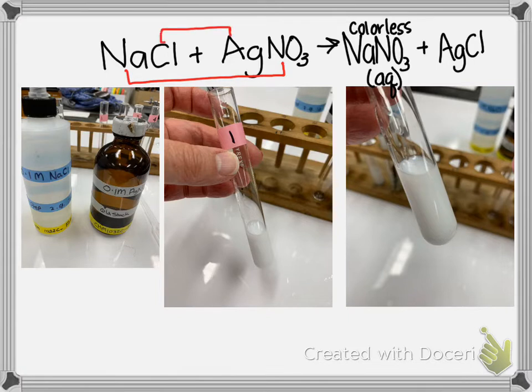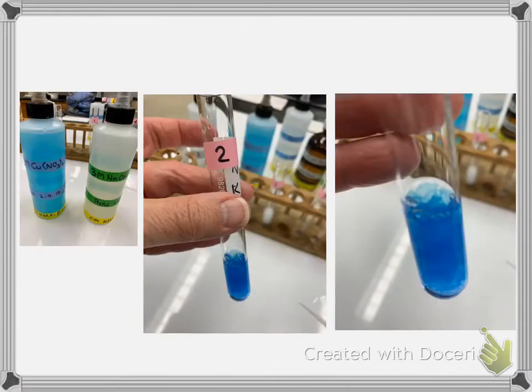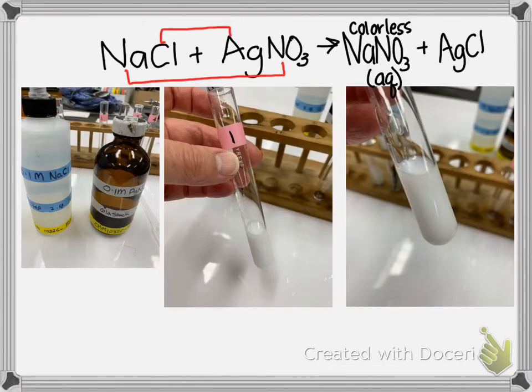Silver goes with chloride, and that is a solid, and it's white. So that white cloudy that you're seeing here, that is silver chloride, and it's a solid. And the liquid part is sodium nitrate.